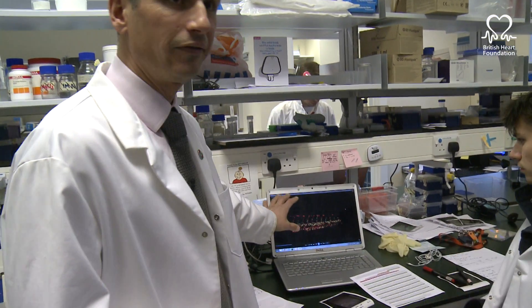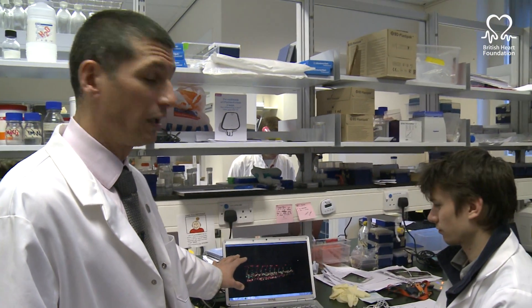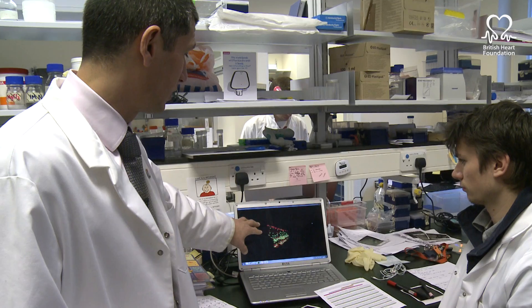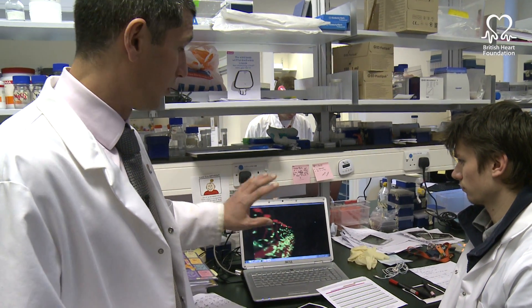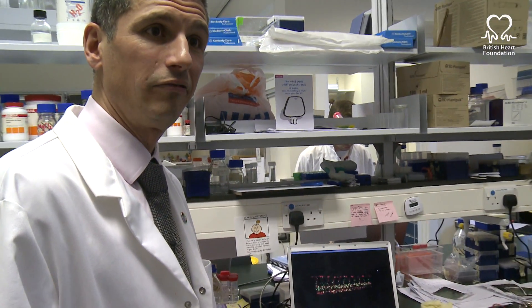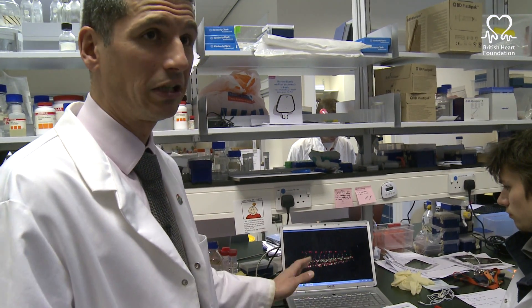This is a living zebrafish larva — the green cells are the lining of the blood vessels and the red is the blood. Nothing's been done to it apart from putting it on a microscope, but you can see we can get really detailed 3D reconstructions of the blood vessels, and you just can't do this in any other organism.